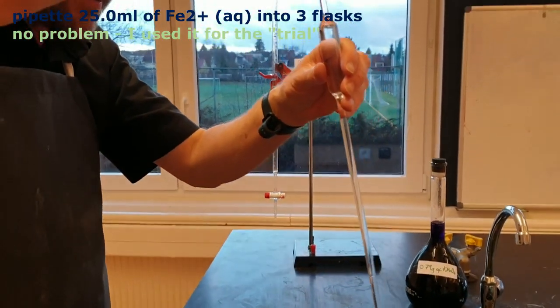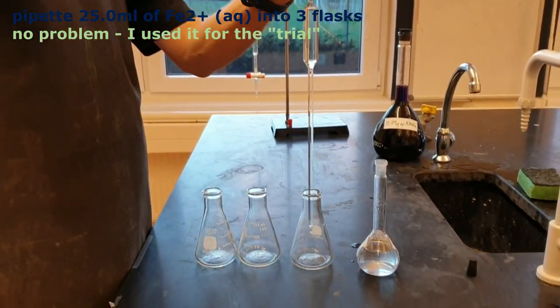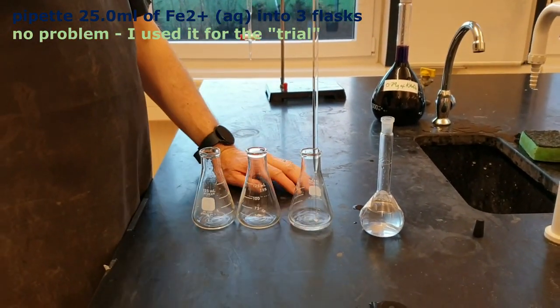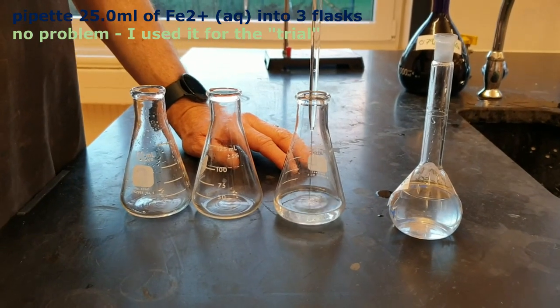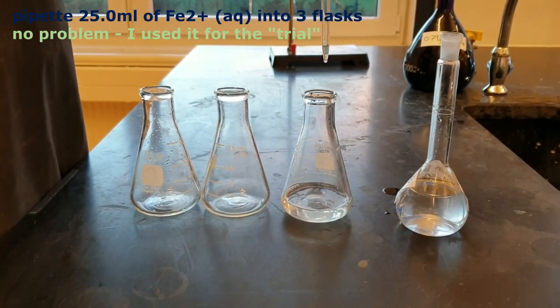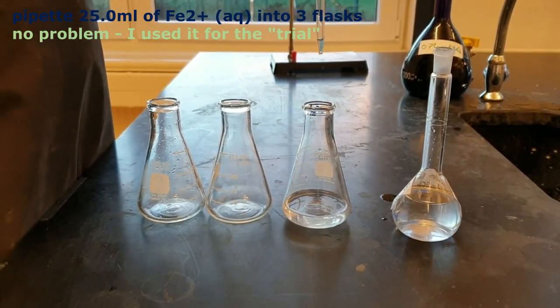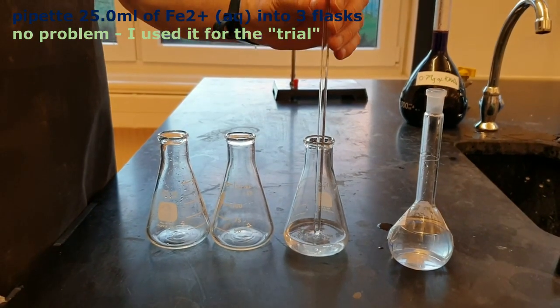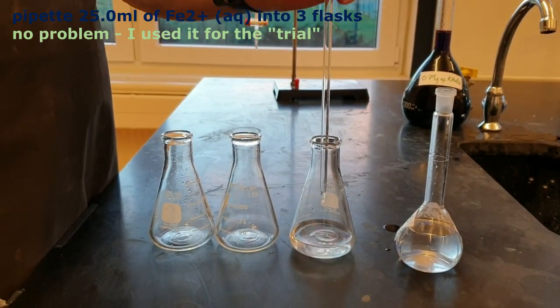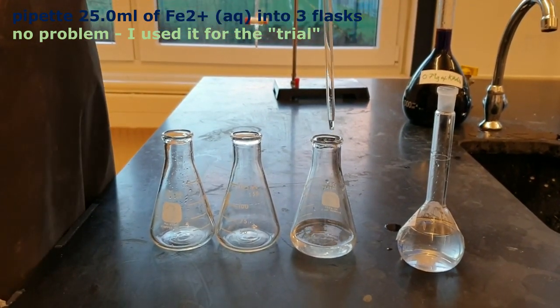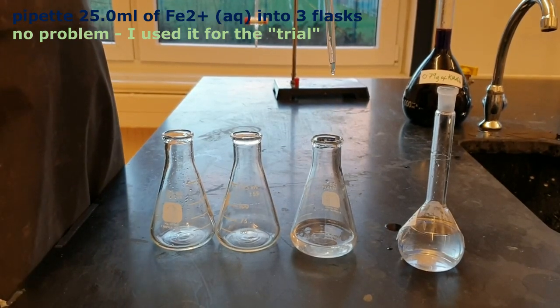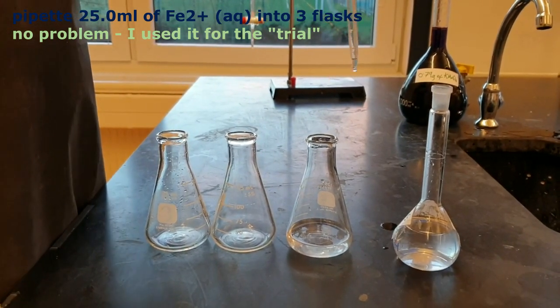Lovely. So that's at the line. Let it go. And at the end it's tempting to blow out that last drop, but you shouldn't. You should just touch it to the surface. It's designed to retain that last piece of solution there. Okay, let's do another one.